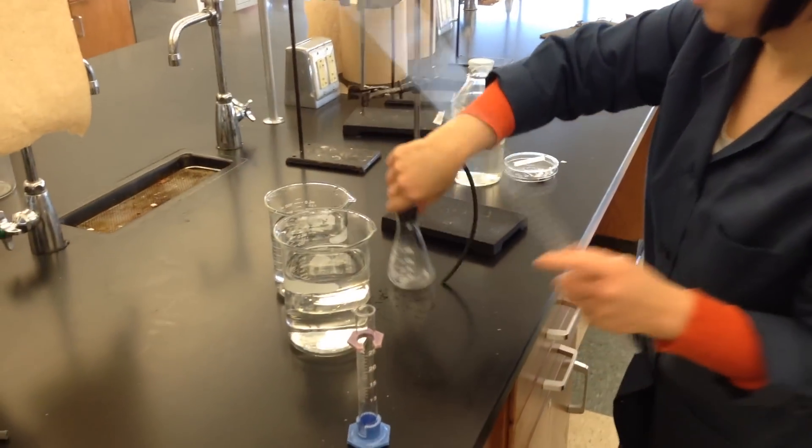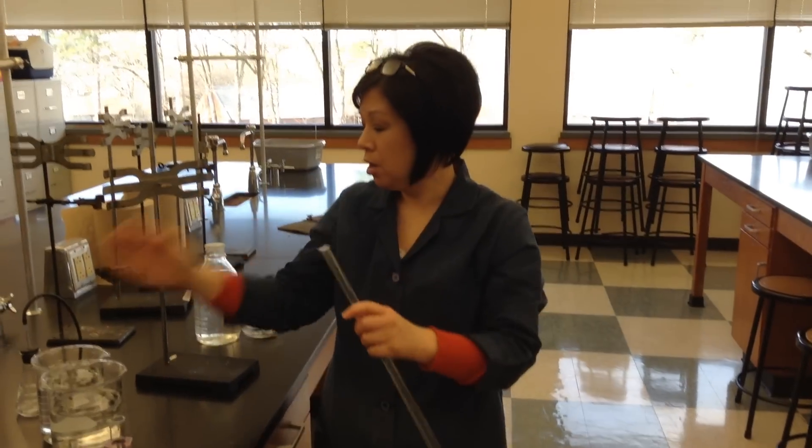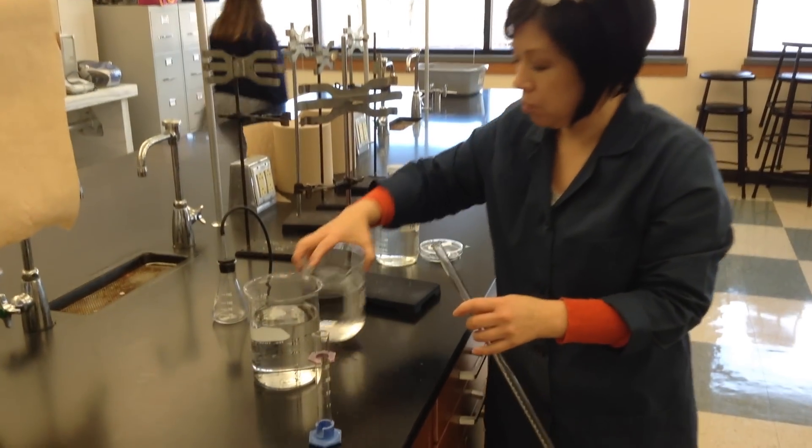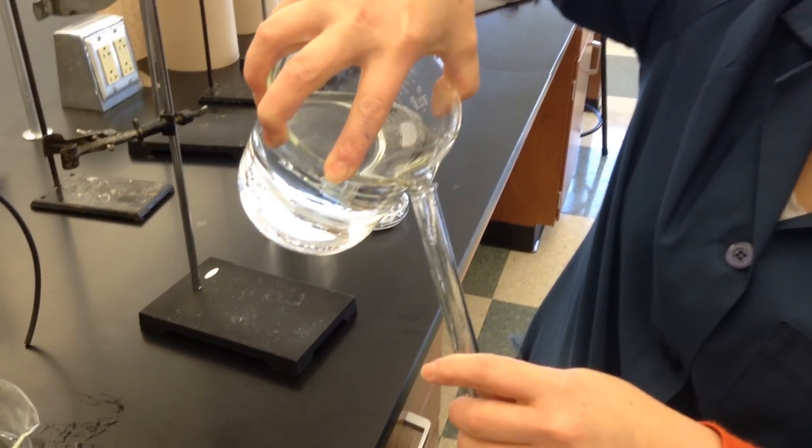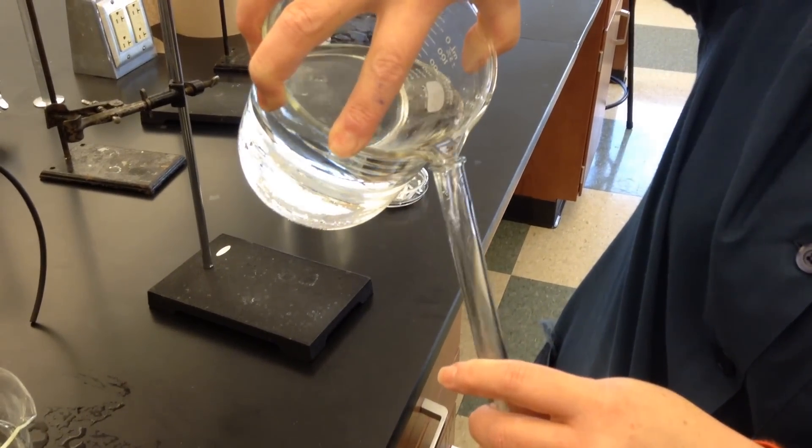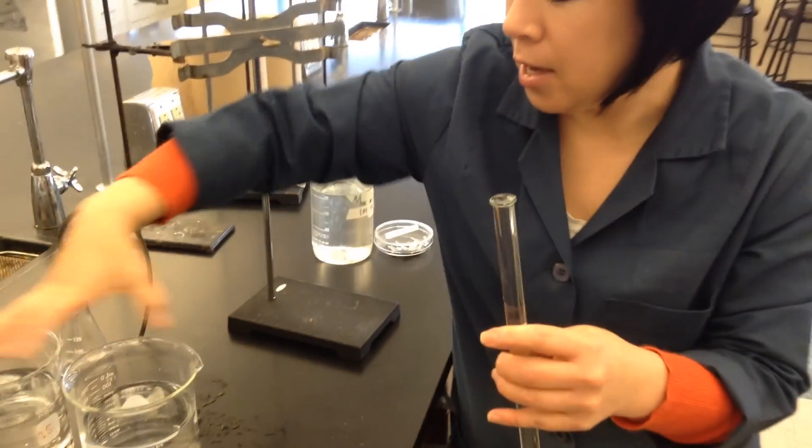You take your handy-dandy eudiometer and you fill it with water up to the tippy-top. You take another really large beaker of water.